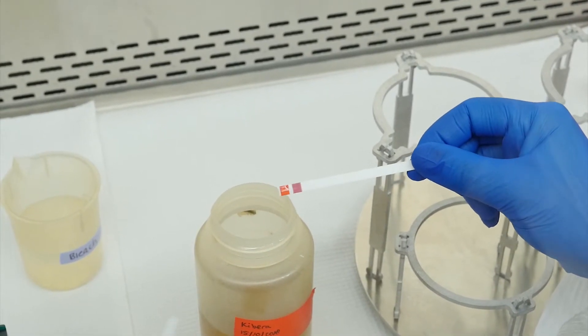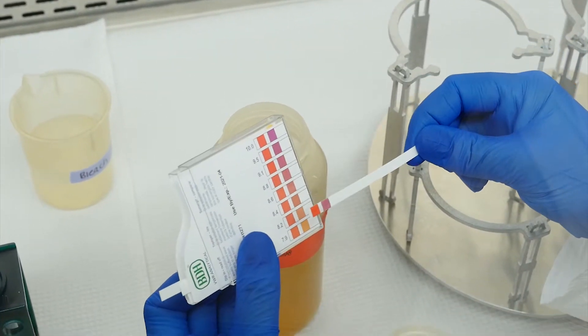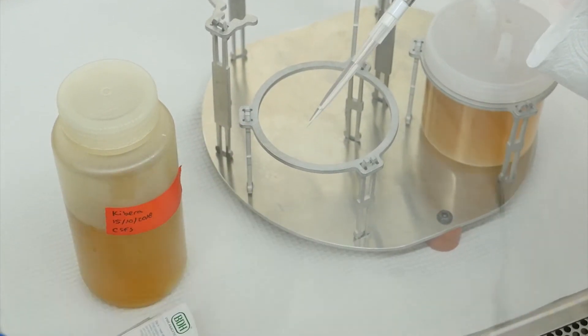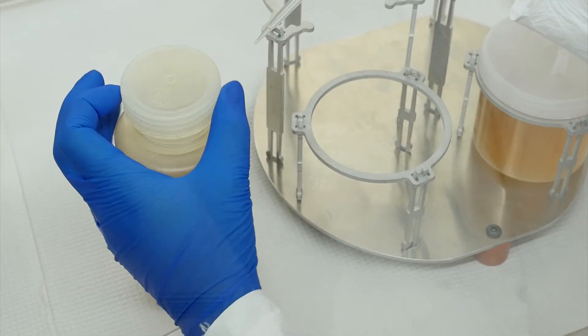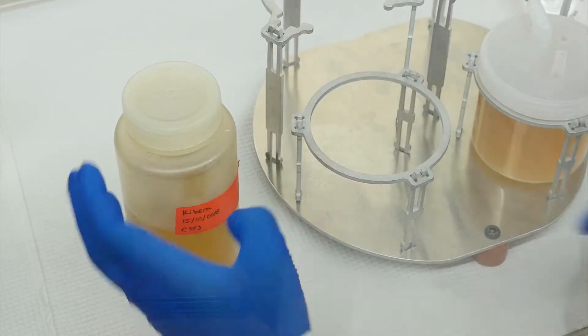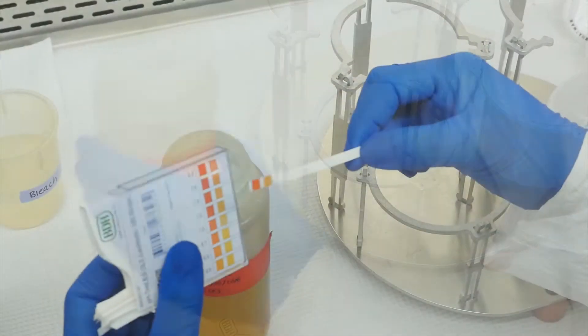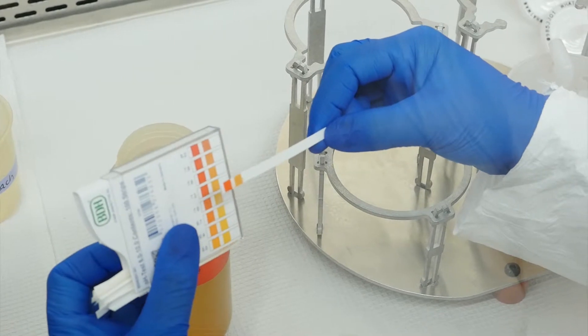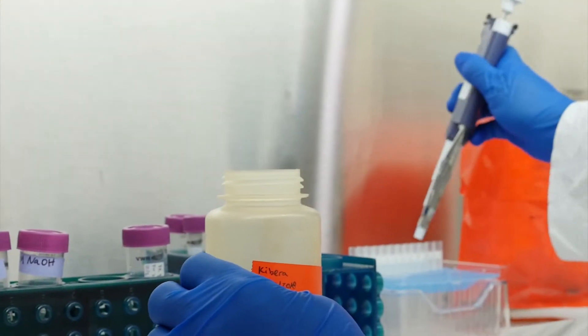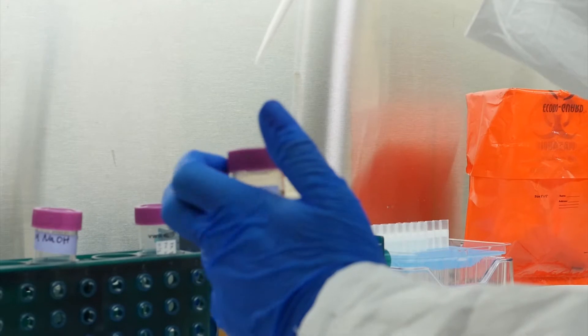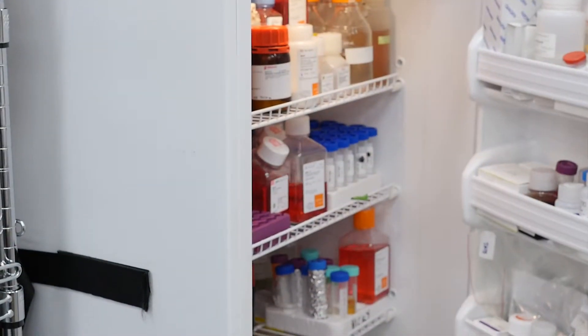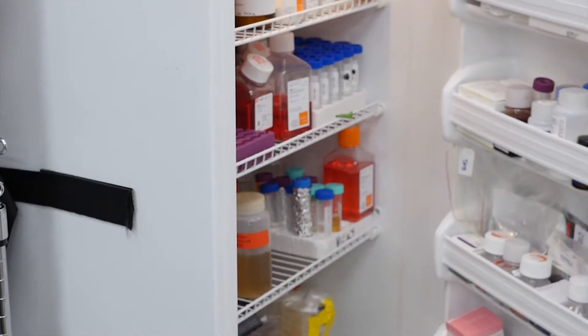Pause your cleanup here to immediately adjust the pH of the eluent to between 7.0 and 7.5 using hydrochloric acid and sodium hydroxide. This will enable your target organisms to be at a stable pH and increase survival. Add reagents in small increments and gently swirl the bottle with the lid on to mix. Check the pH using pH strips. Compare with the standard and discard the used pH strips in a biohazard bag. Note that pH adjustment has potential for cross-contamination. Only open one sample at a time and use sterile technique. Store the pH adjusted sample at 4 degrees Celsius until secondary concentration.